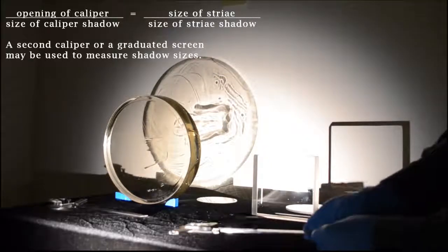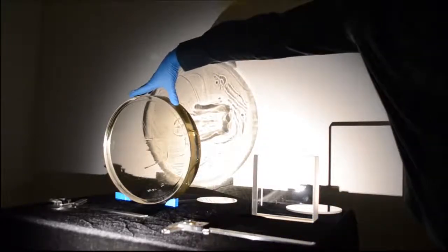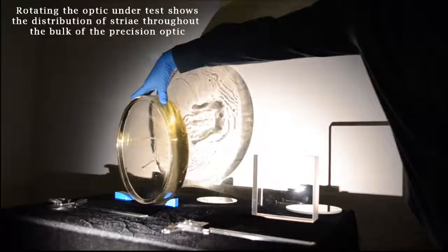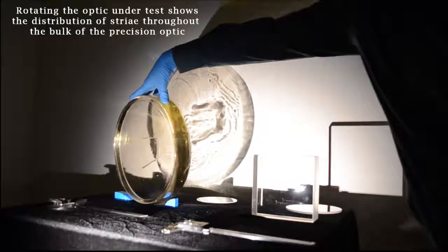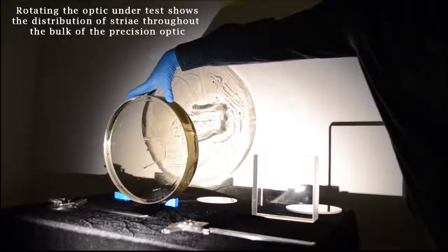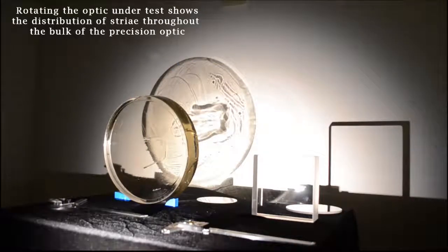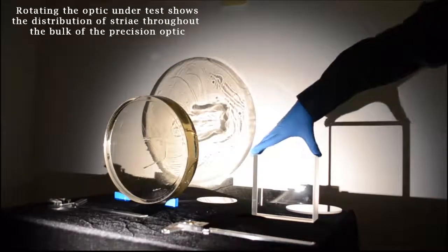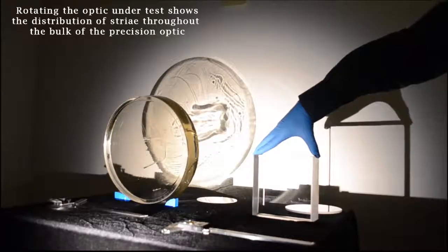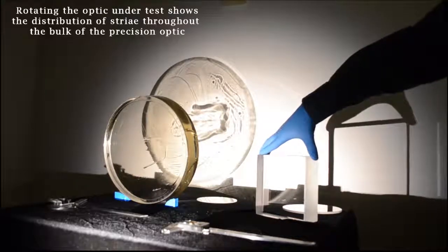We can also look through the bulk of the material, and we can see that the distribution of the striae changes as we rotate the material to an angle of about 30 degrees in that case. So you saw the shadowgraph of the striae change its distribution as I rotated that optic. However, with the Class 5 Grade A optic, as I rotate that, you don't see any discernible striae distribution.